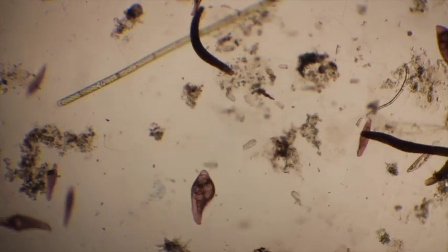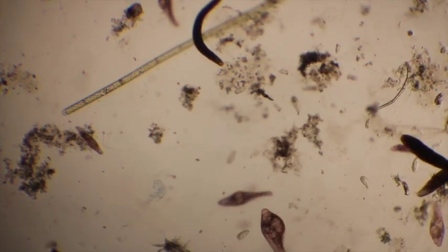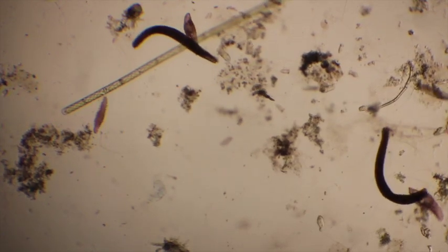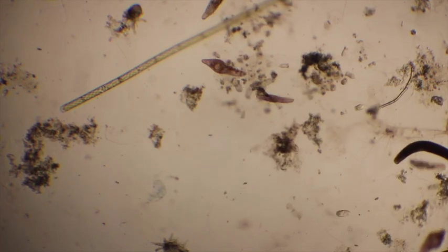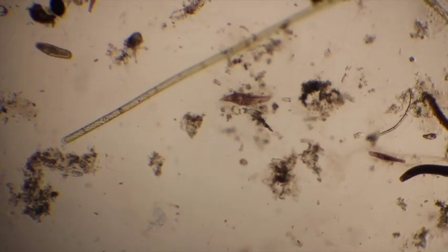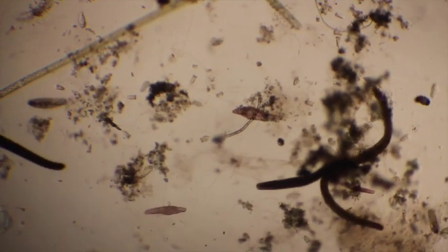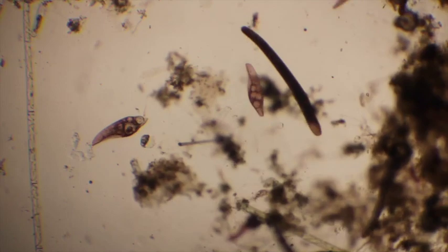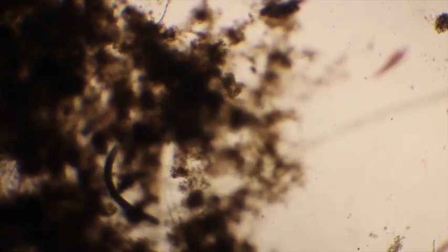Alright, here is our view of the ciliate culture under the 4x objective. And we can see a lot of ciliates. So all of these guys zooming around then are different types of ciliates. You can see the long, dark, worm-like ones here. These two long, worm-like guys there. Alright, so I'm going to search around a little bit and then find some things to try to focus in on so you can actually see the cilia.